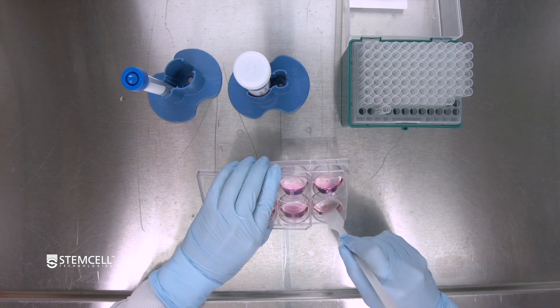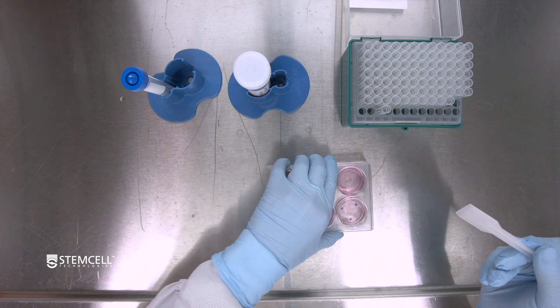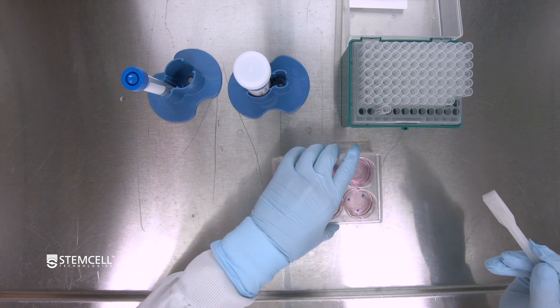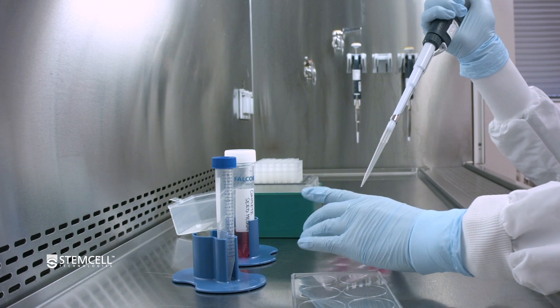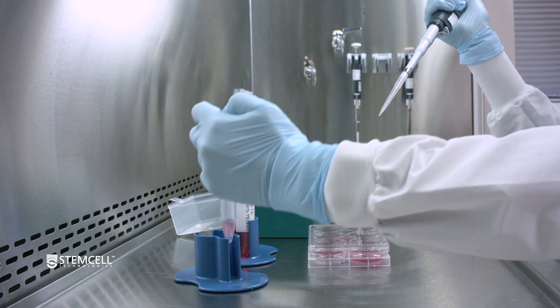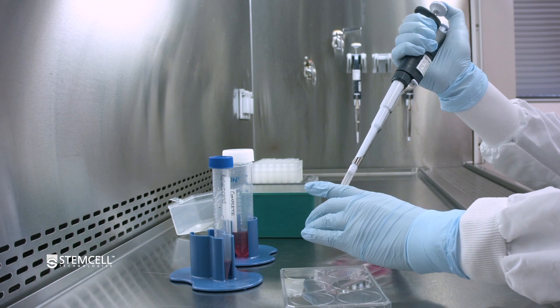Detach the colonies by scraping with a cell scraper or a serological glass pipette. Angle the plate and scrape the top half, then flip the plate and scrape the other half. Transfer the detached cell aggregates to a 15 ml conical tube using a P1000 pipette. It is optional to rinse the well with an additional 1 ml of complete seed medium to collect the remaining aggregates.